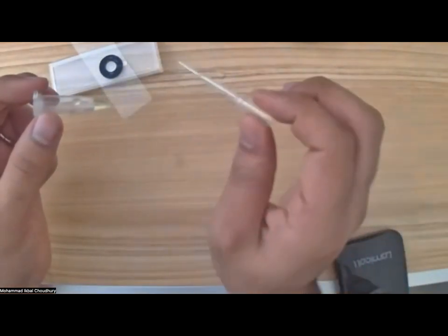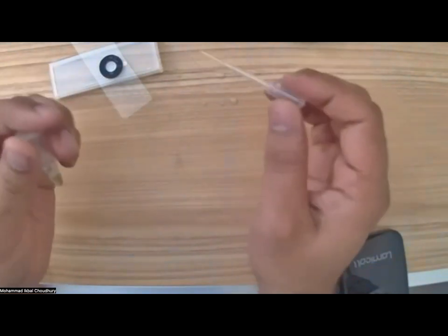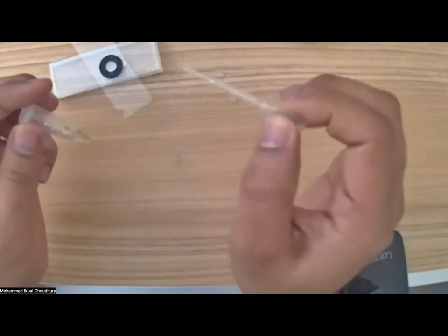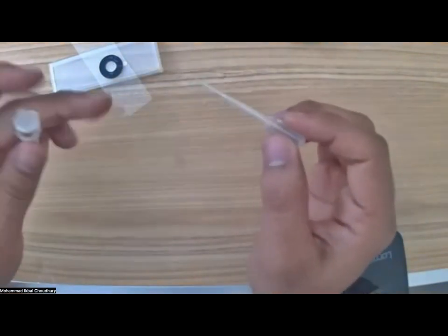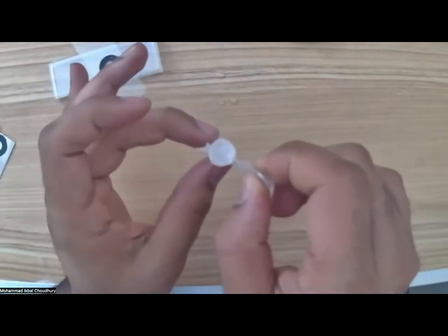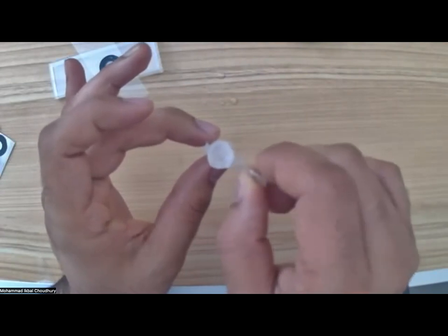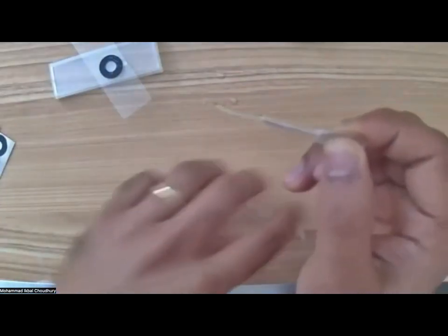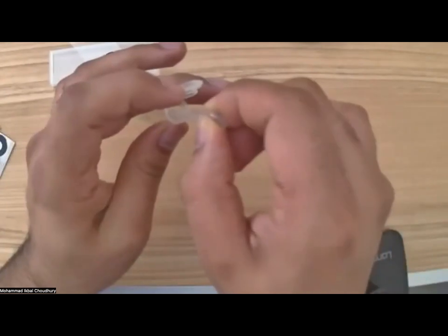The other thing is, it's called a dropper sometimes. Yeah, a dropper. I'm sure you have used it many times, or in some COVID test kit and all that. Okay, so I will just gently stir the sample like that, and I will take a droplet. Well, I cannot guarantee. Well, wait. I have to put it back because the ring sticker is not yet open.